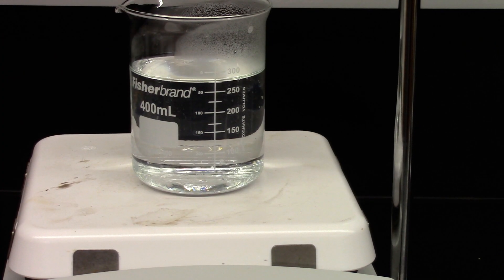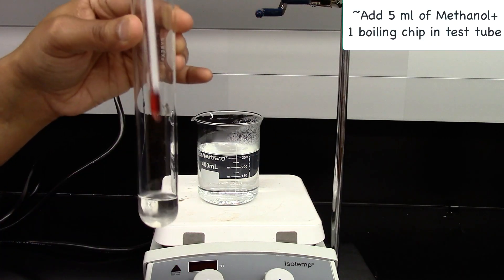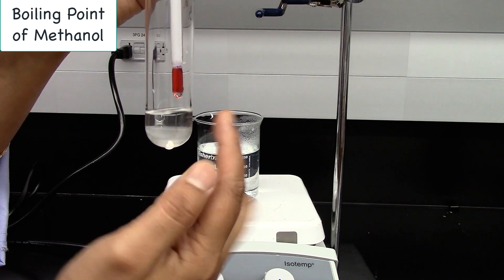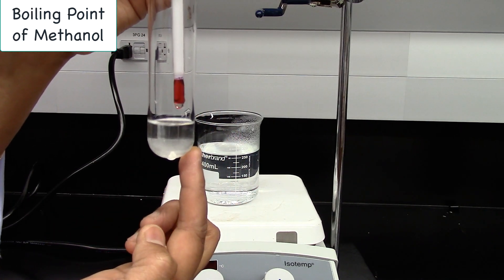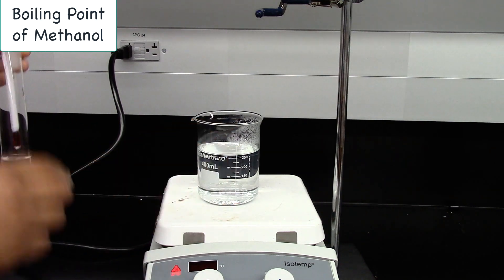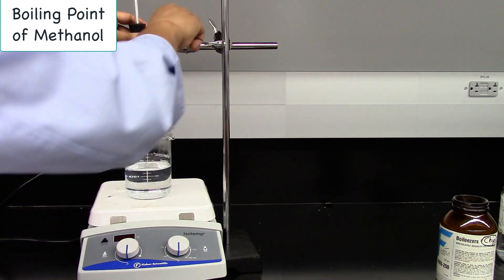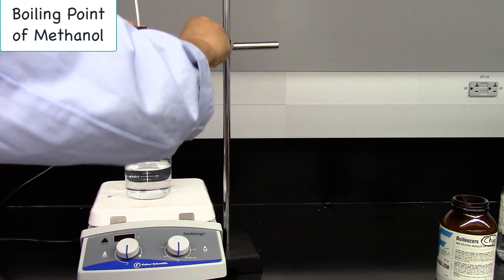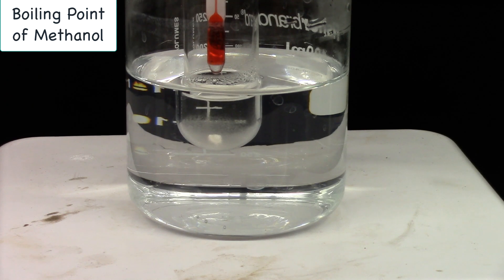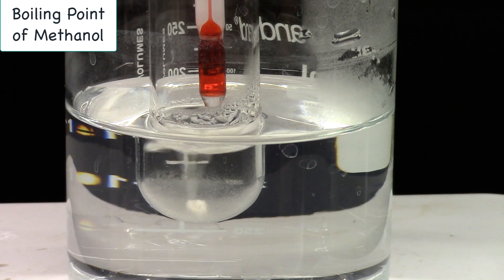The water is gently boiling. I am going to turn the heat off. Here is my methanol with a boiling stone. I am going to insert my thermometer, which is connected to a stopper, and the thermometer tip should be about 1 cm above the alcohol. I am going to clamp this on top of the hot water beaker. I am going to gently lower this inside the hot water. We are waiting for a steady drip from the tip of the thermometer. The alcohol is boiling but we will wait until there is a steady drip.